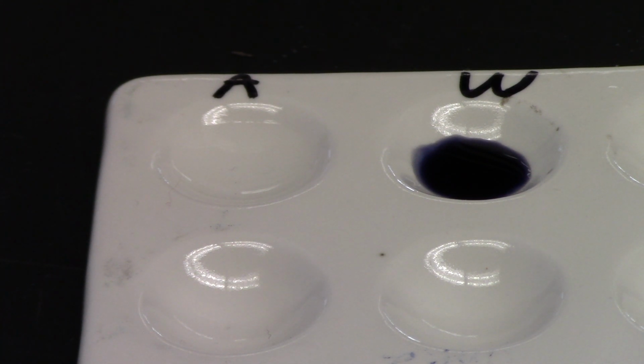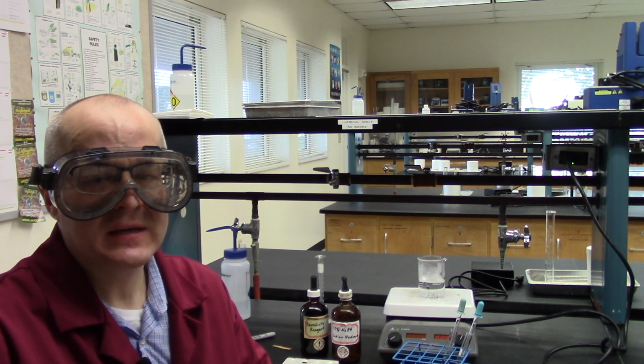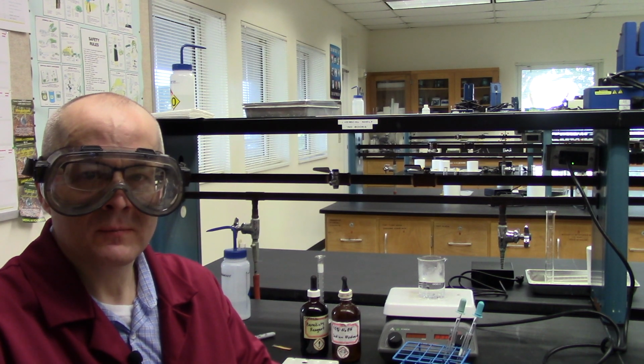So now I'm going to take a brief pause. I'm going to reset my cameras to do the last step of today's lab, the Benedict's test for glucose. But just bear with me for a second, guys, while I reset my cameras. Okay, guys, we're back again. We're going to do the Benedict's test now on the solutions we just heated.